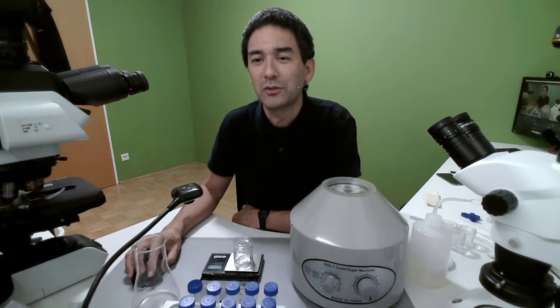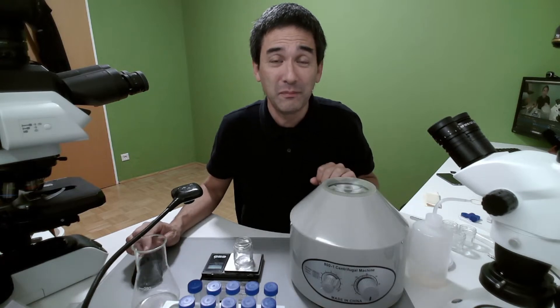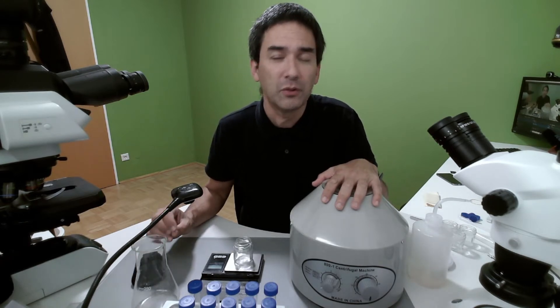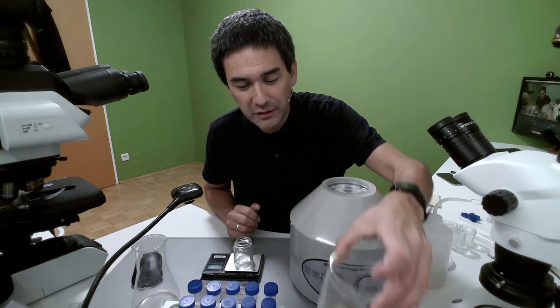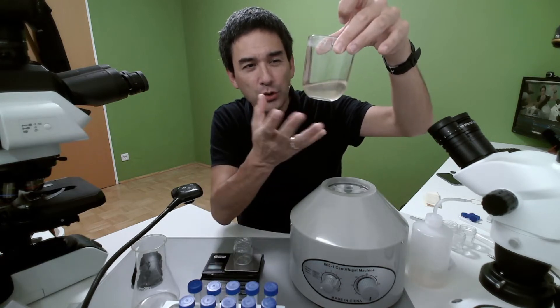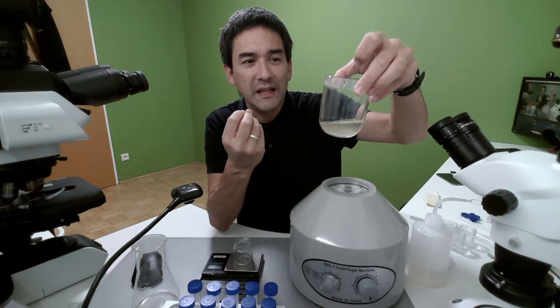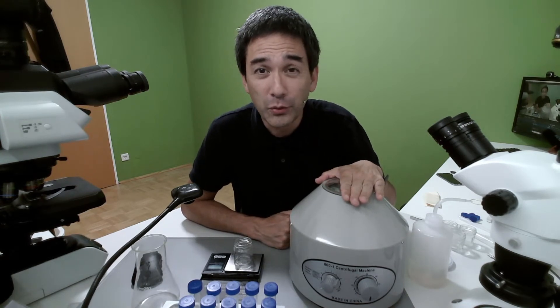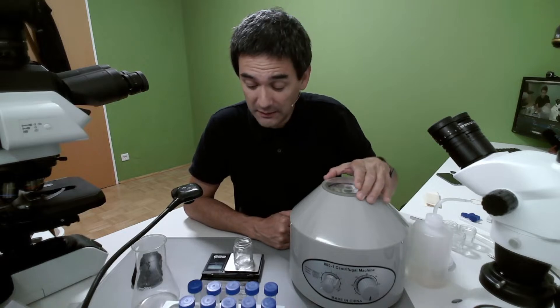The first question is: what is this machine used for? Some of you might not really know — it's used for separating, or more precisely, concentrating very small particles. If I put a solution directly under the microscope, the concentration might not be high enough to properly see it. The centrifuge allows me to concentrate whatever is in the sample to make it much more dense. This machine was ridiculously cheap — I only paid around 30 or 40 euros or dollars for it.